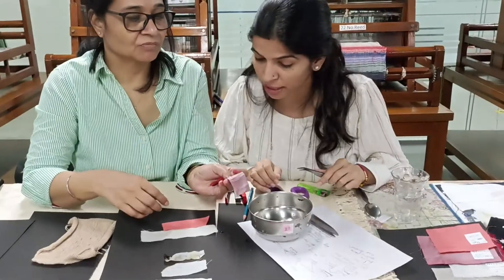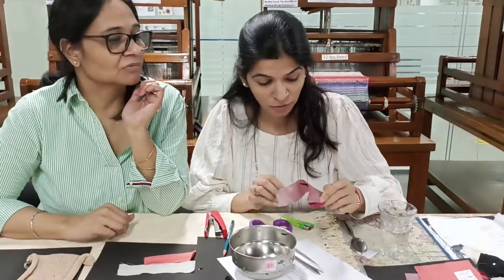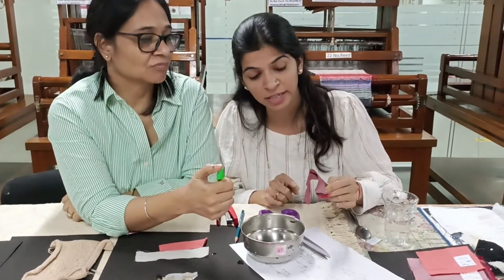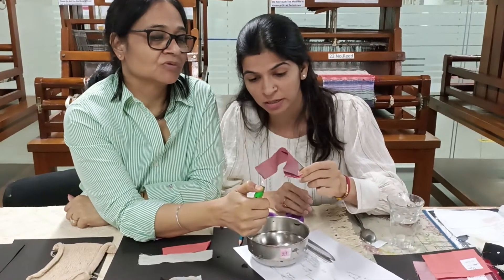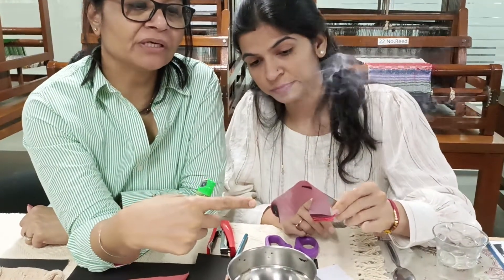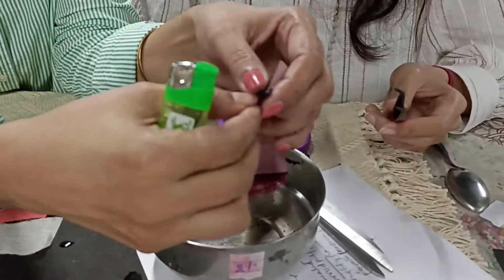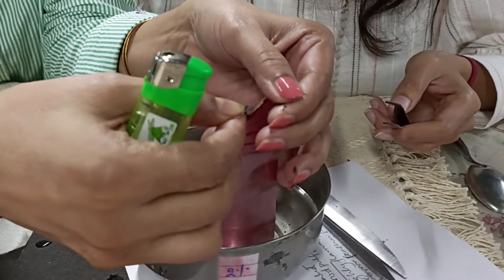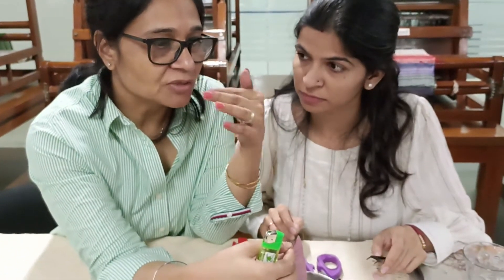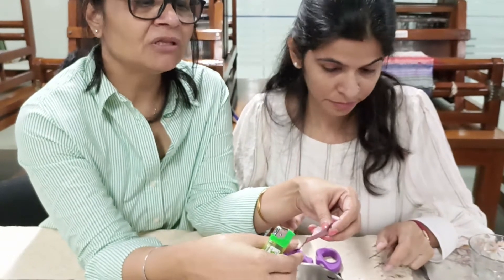Now let's come to the protein fibre category, starting with silk fabric. In case of protein fibre content, when you bring it close to the flame, it generally curls away from the flame. This is self-extinguishing — it does not carry any flame. When the source of flame is removed, it automatically extinguishes. It also forms an ash which is crushable, along with bead formation. It also gives a pungent smell — a rotten egg smell. These fibres are basically safer to burn.